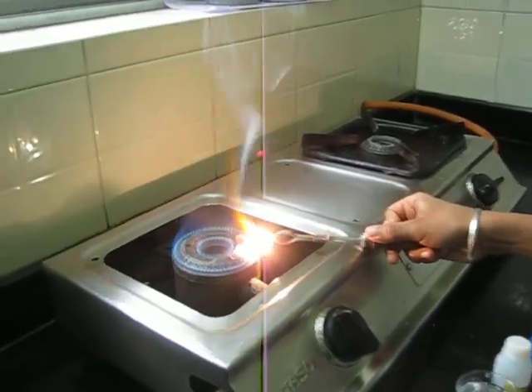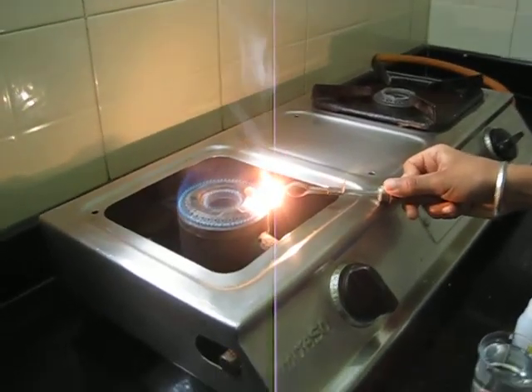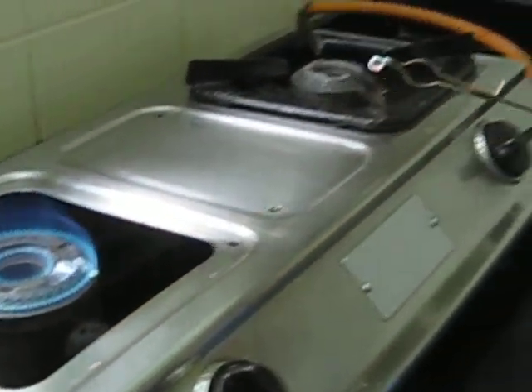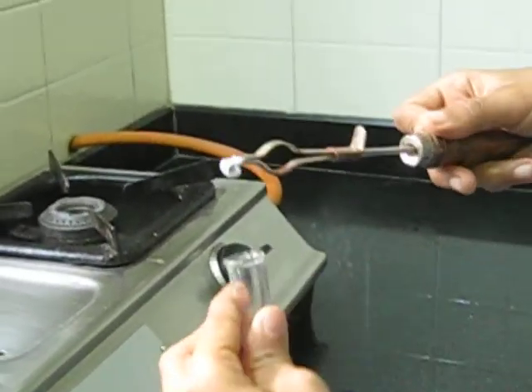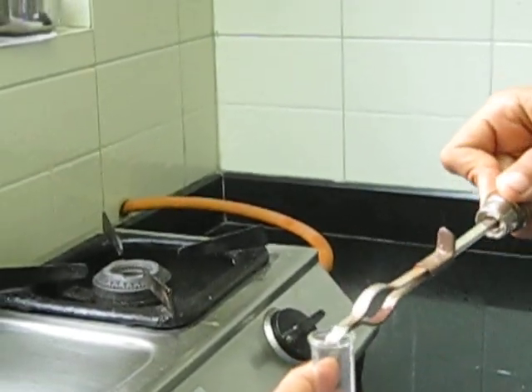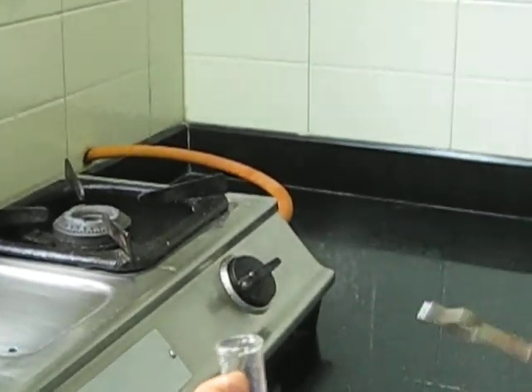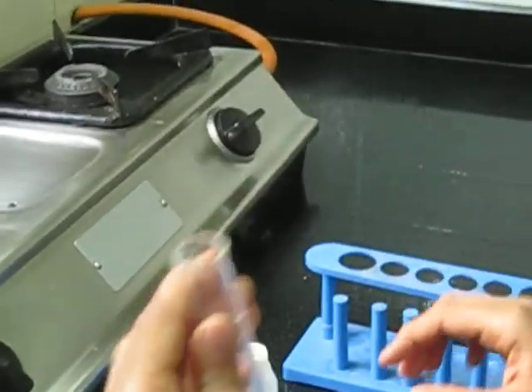Magnesium burns with a dazzling flame. We will collect it in a test tube. This white powder is MgO.